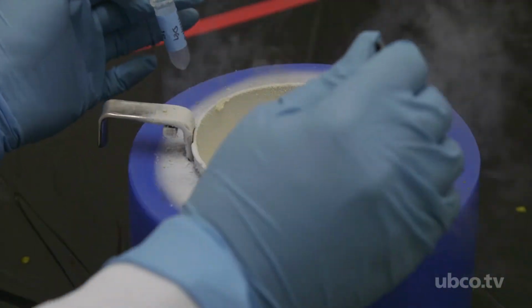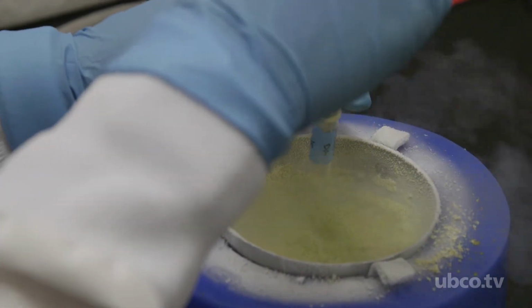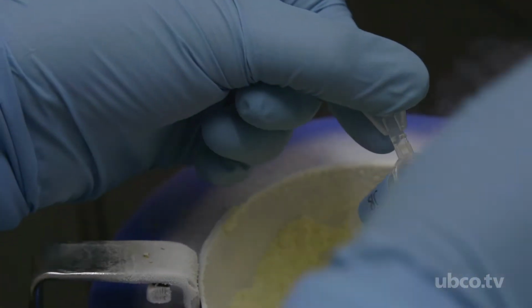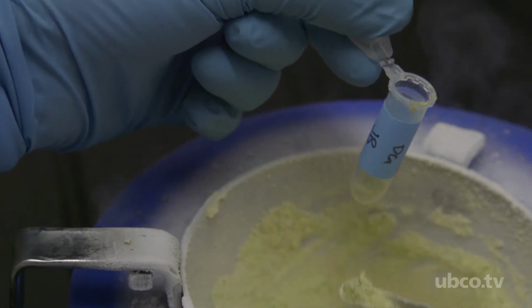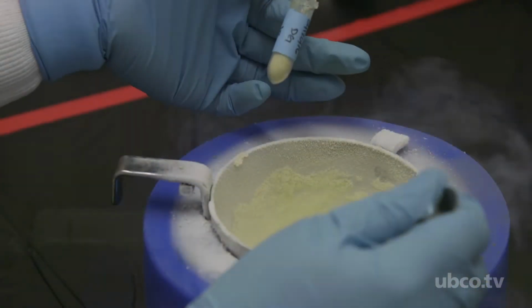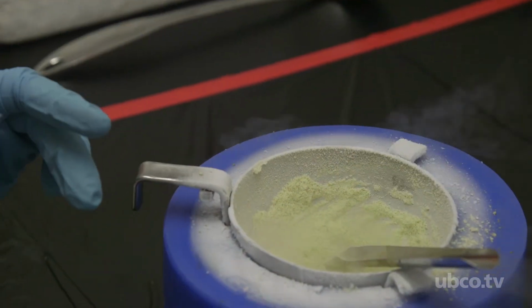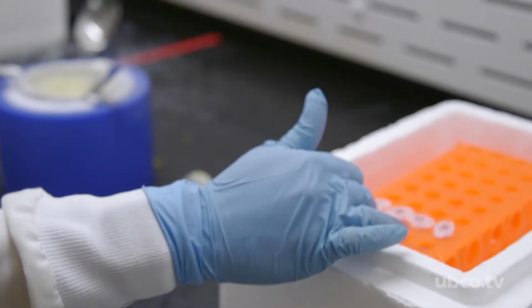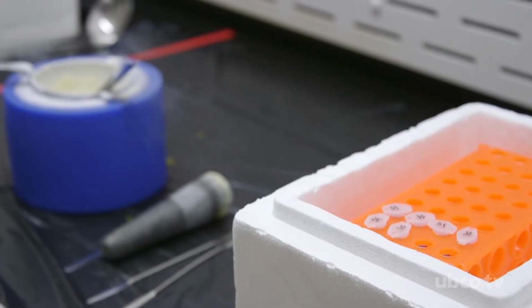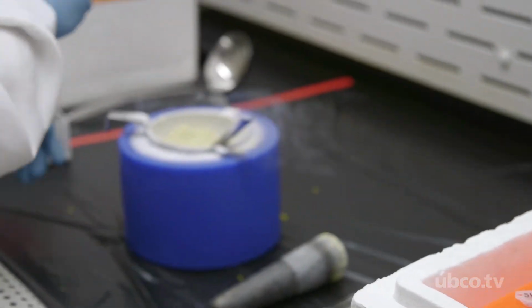And so once this consistency has been reached, we transfer it into our tubes. 2 of our tubes are filled only a quarter of the way full. And so these ones are going to be used for DNA extraction and for RNA extractions. I've just completed the extraction tubes. We're going to move them into our storage box and put them into the -80-degree freezer. Again, we want to keep everything nice and cool.